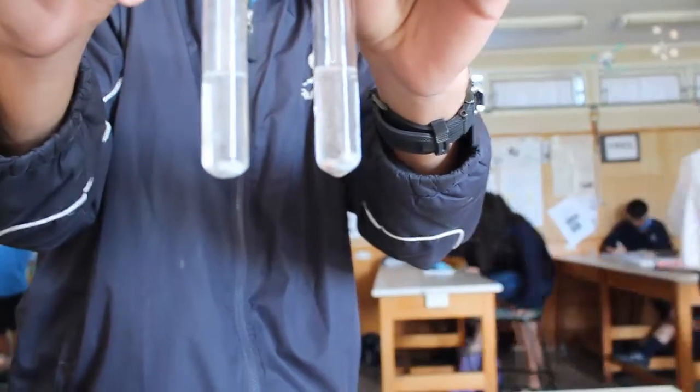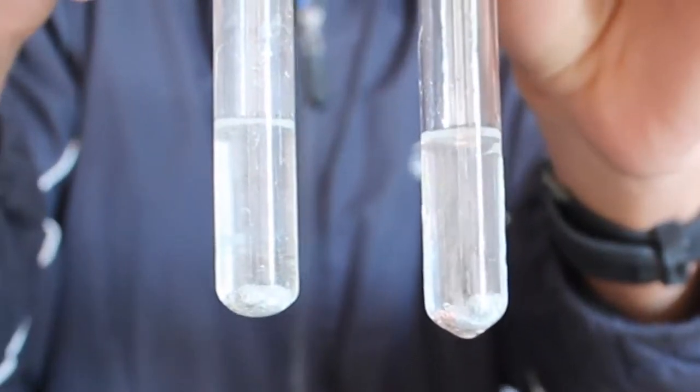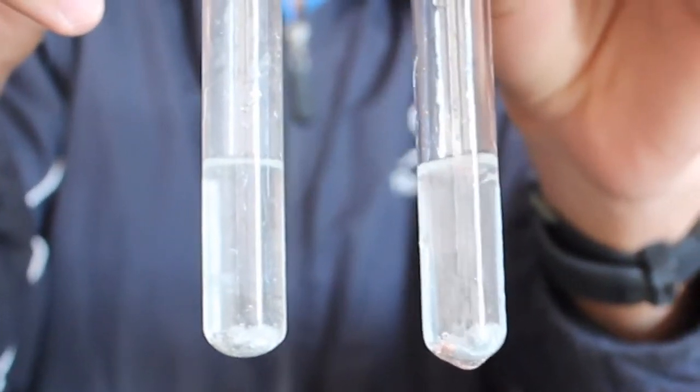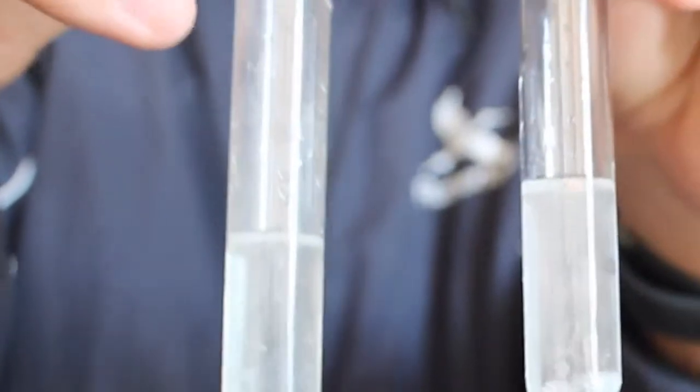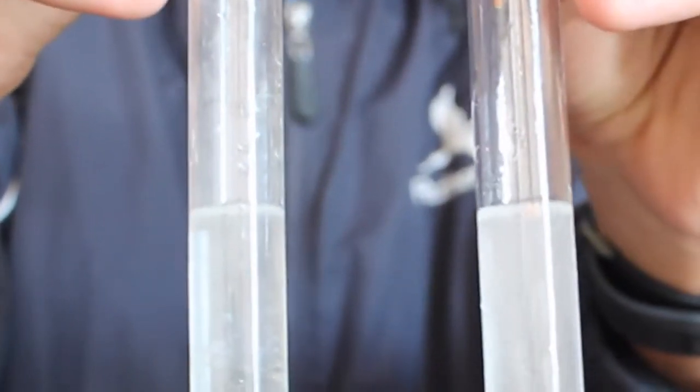Now notice that the bubbling, which is just the dissolving of the zinc metal in its reaction, is occurring faster in the test tube with the copper shavings rather than the one without the copper shavings. This is the catalyst in effect.